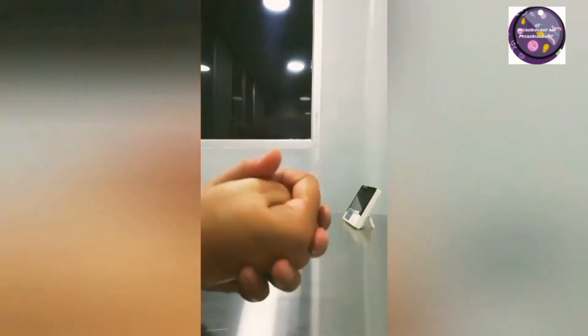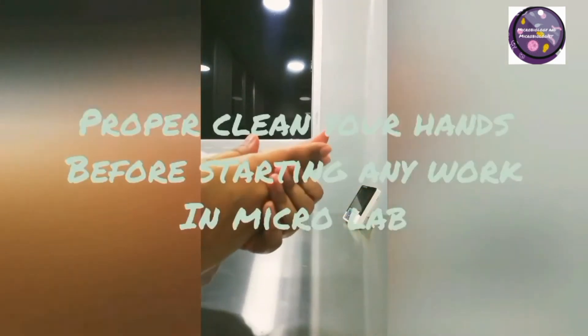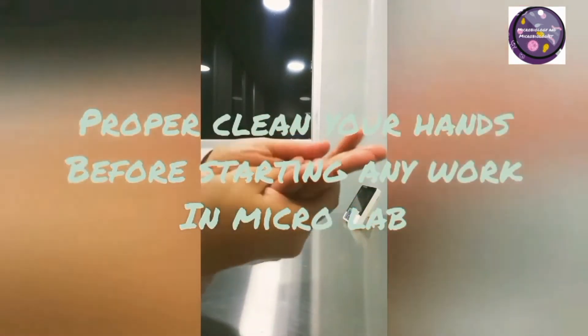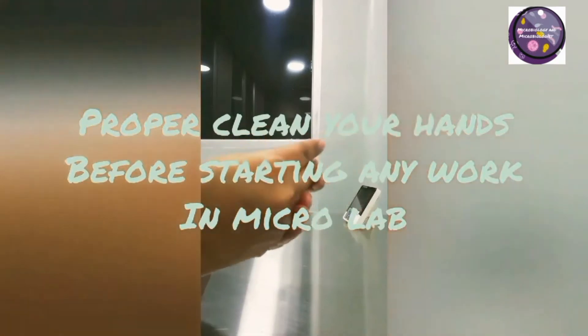After cleaning your hands, wear a mask, head covers, and other PPE — that is, personal protective equipment — as per requirements. Disinfect your hands before starting work under laminar airflow hoods or in the microbiology lab.